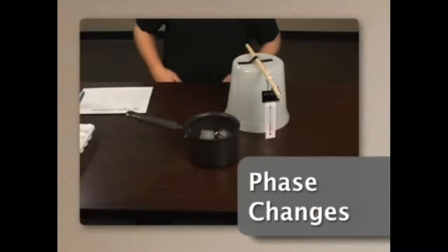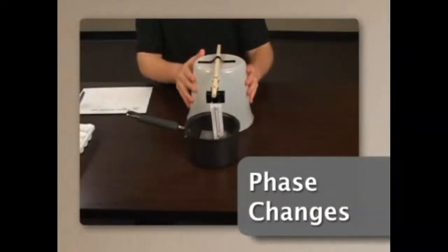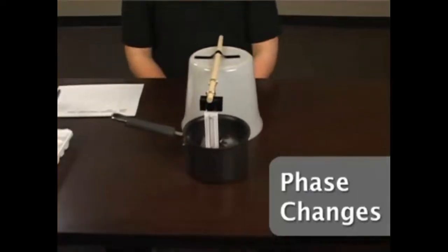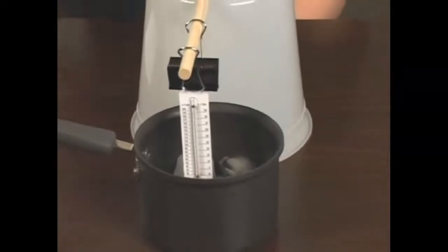I'm Pat Keeney, an instructional designer with K-12. Along with my assistant, we're here to work with you on a lab that explores changes of phase. In most lab work, advanced preparation is needed, and safety is always important to consider.